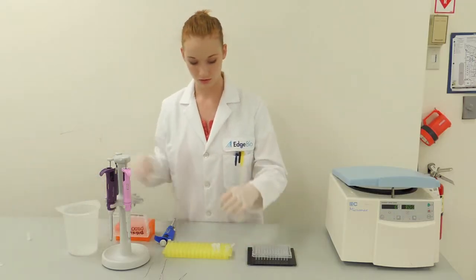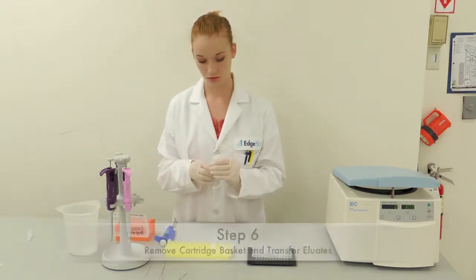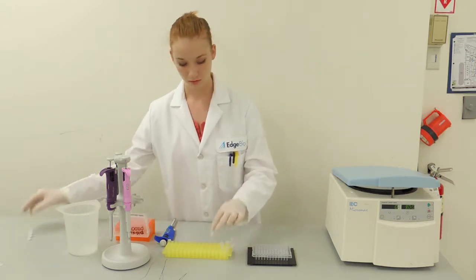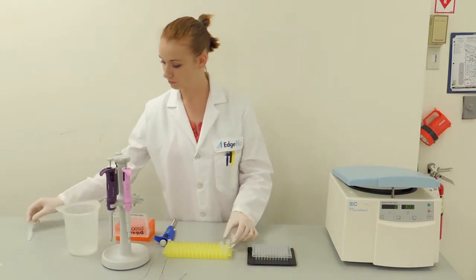Next, remove and discard the cartridge baskets from each individual cartridge. One of the benefits of using cartridges is that no columns are wasted since the amount of cartridges used is tailored to fit each experiment.